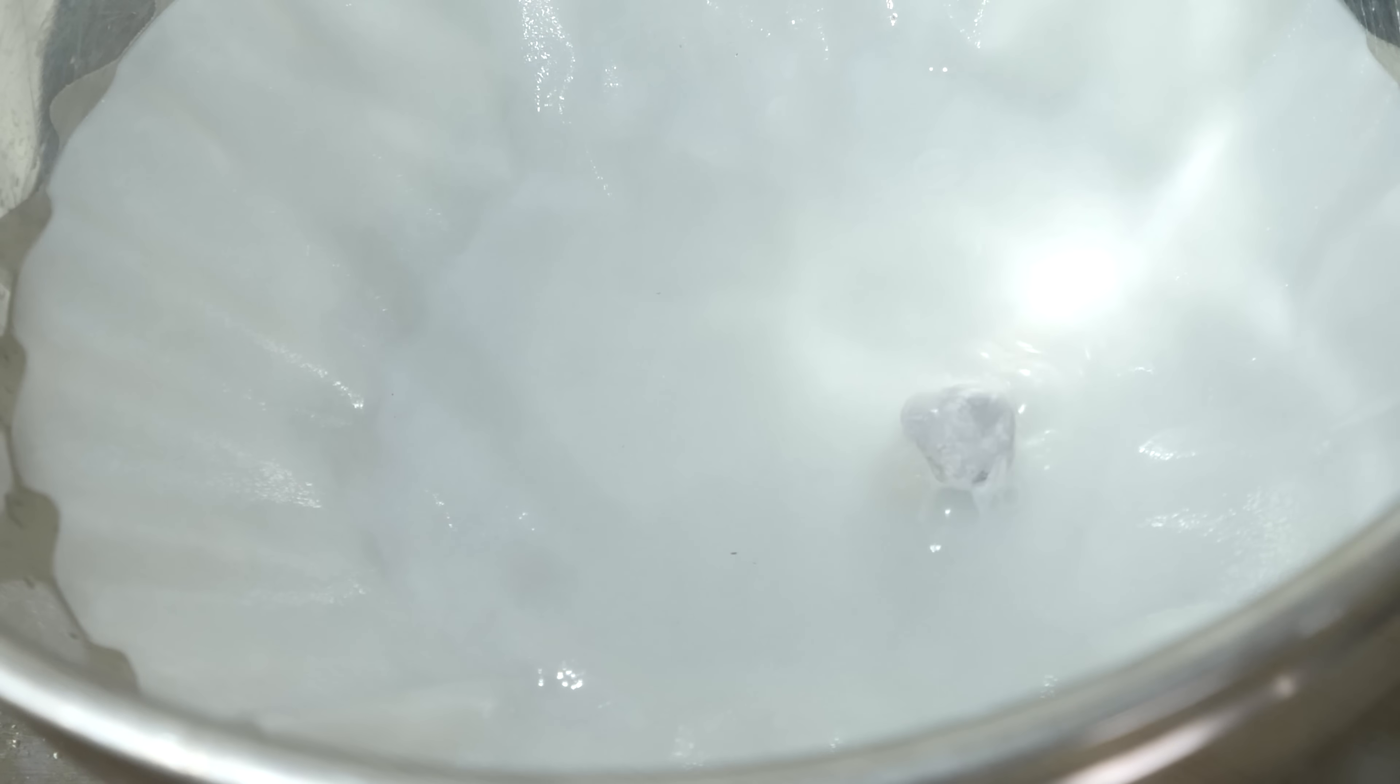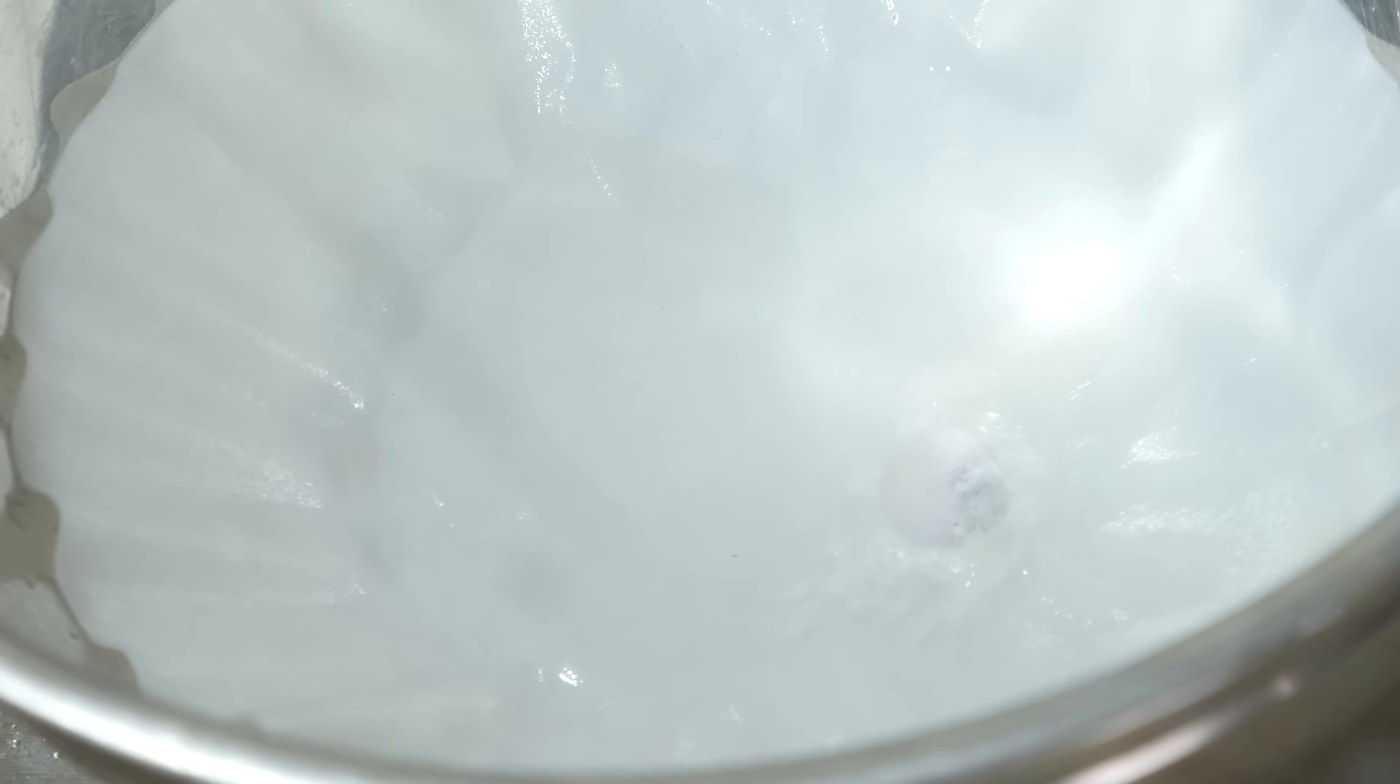And since the sodium hydroxide is so hot, it's actually in its molten state. So you end up with a molten drop of this alkaline metal hydroxide. So the reason for the filter paper on top here was just to slow the sodium reaction down with the water, so it doesn't all happen at once.